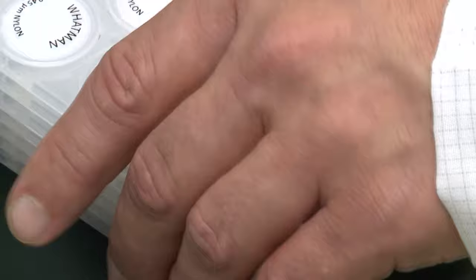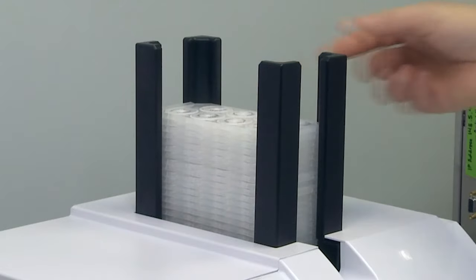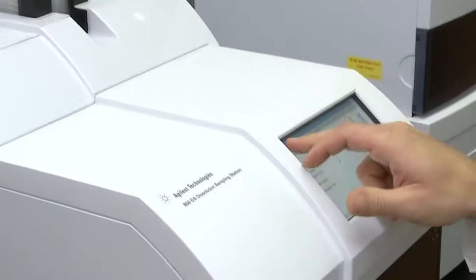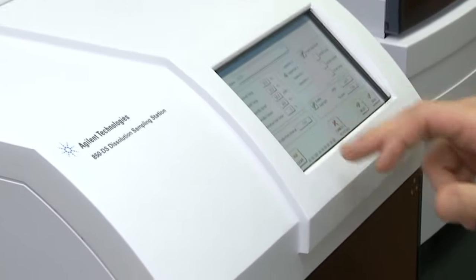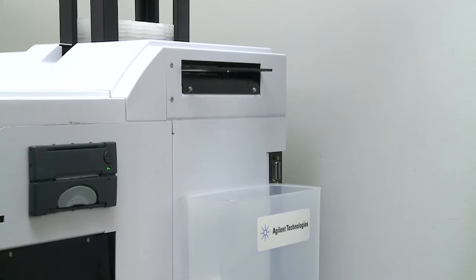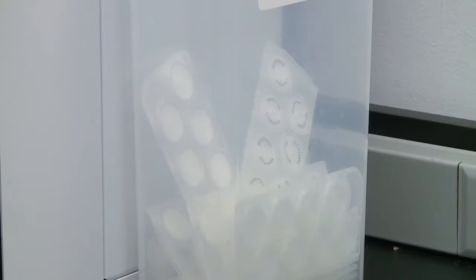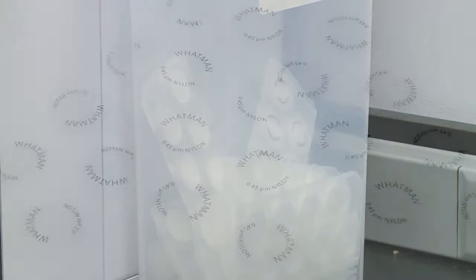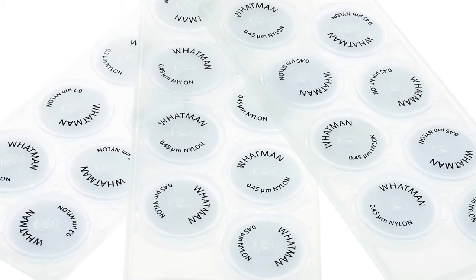Many labs will employ automated steps in dissolution testing due to the repetitive nature and high number of samples to be tested. However, for a filter device to be suitable for automated dissolution equipment, it must have specific physical characteristics to ensure it is fully compatible with the pieces of equipment.